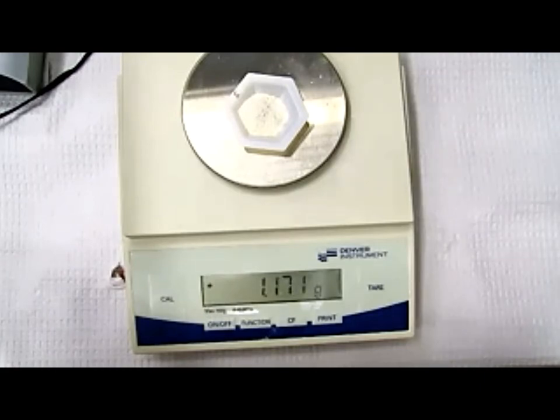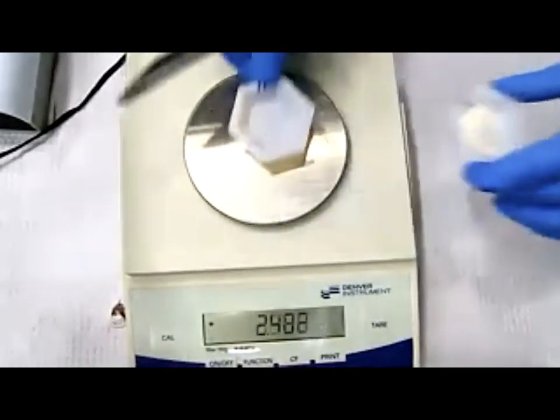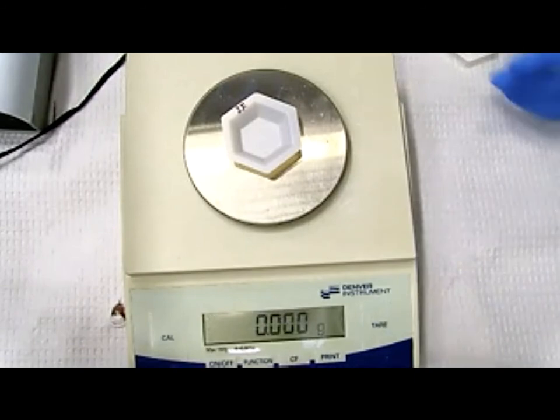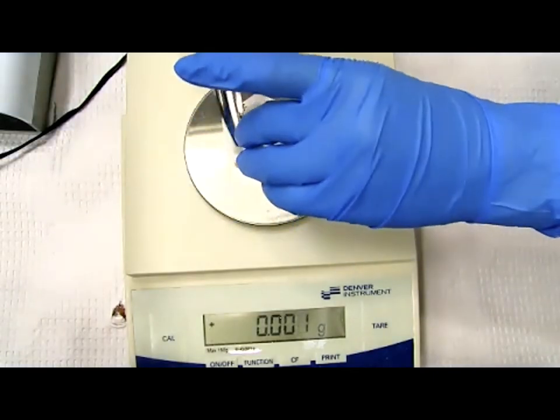All right, we should be good to go. Okay, so we need to finish the measuring of 2 chemicals, indomethacin. So I have a weigh boat. Now it says IF. That's my final weigh boat for indomethacin. And I believe my target weight is 980.